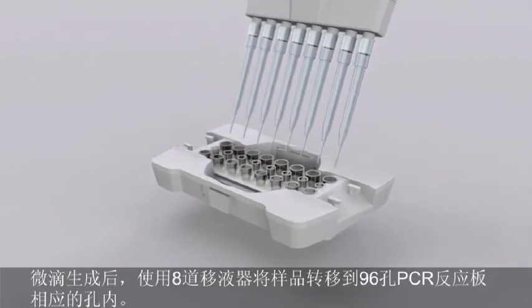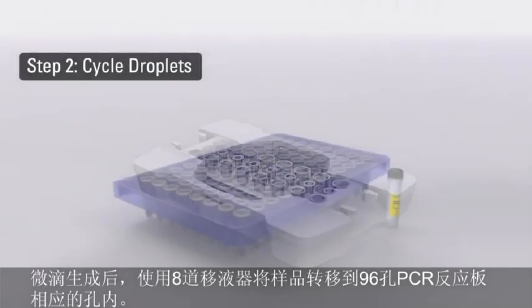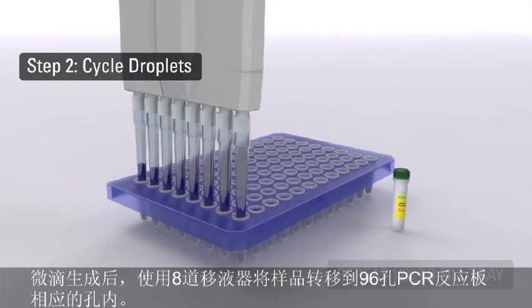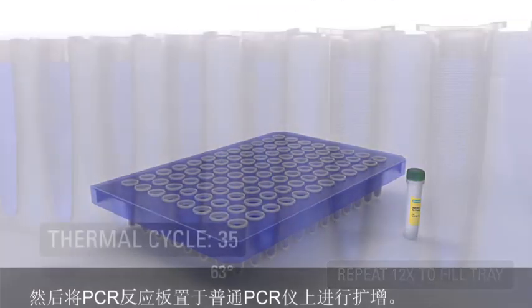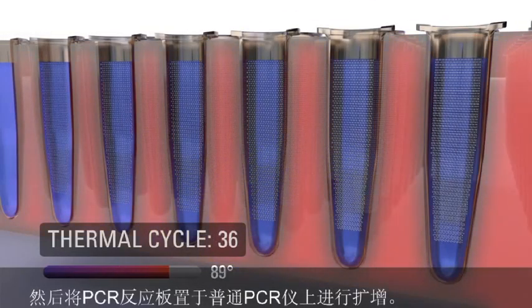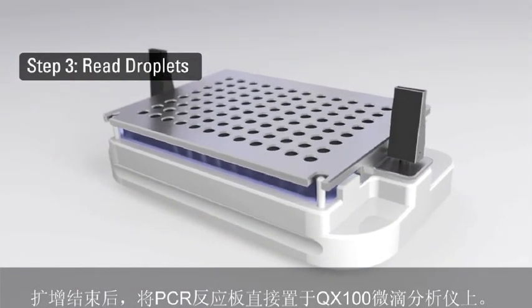After the droplets are generated, the emulsified samples are transferred to a standard 96-well PCR plate using a standard 8-channel pipette. The plate is then loaded onto a thermal cycler where PCR is performed to amplify the target DNA to endpoint. When PCR is complete, the plate is loaded onto the QX100 droplet reader.